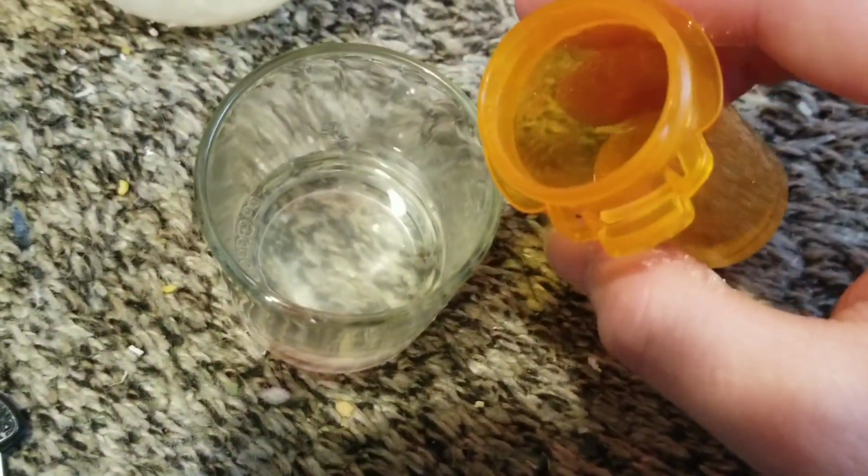So if the reaction did not work, or only partially worked, then this will turn cloudy. Yes, and you see how cloudy that is? Yeah, the reaction didn't really produce the results that I had hoped for. The two solutions did not mix as much as they were intended to, which is why the crystals we see are so small.